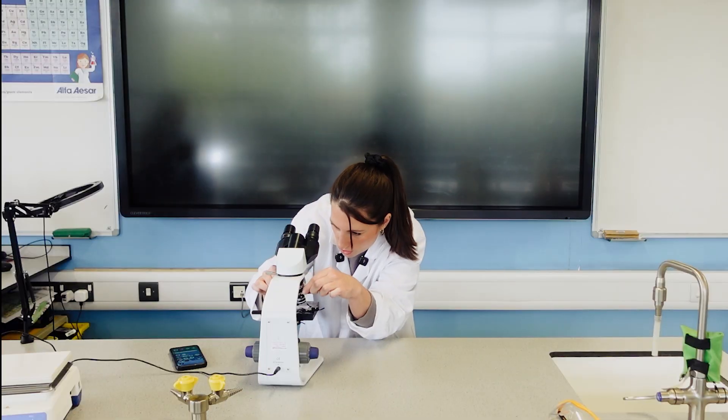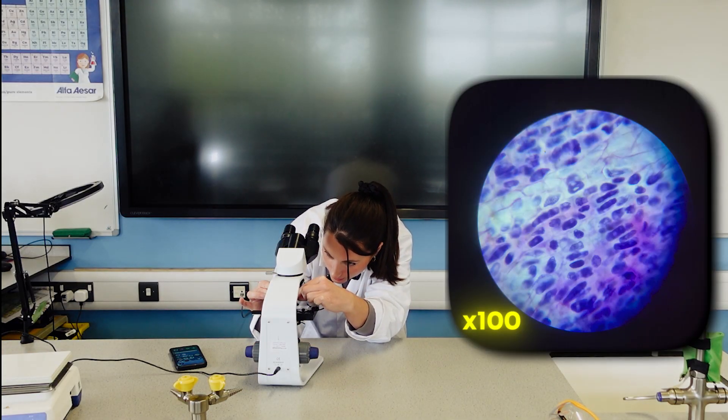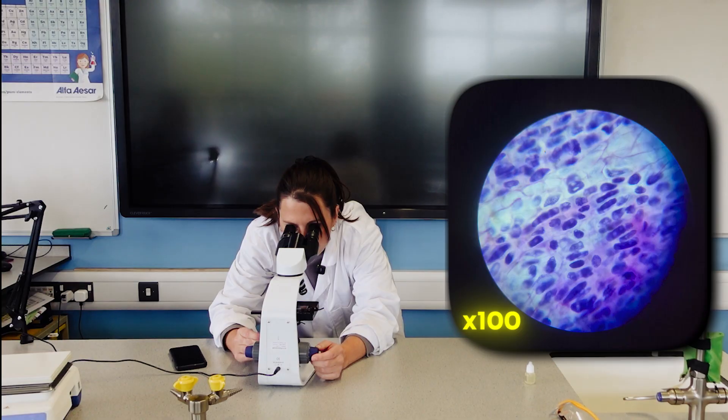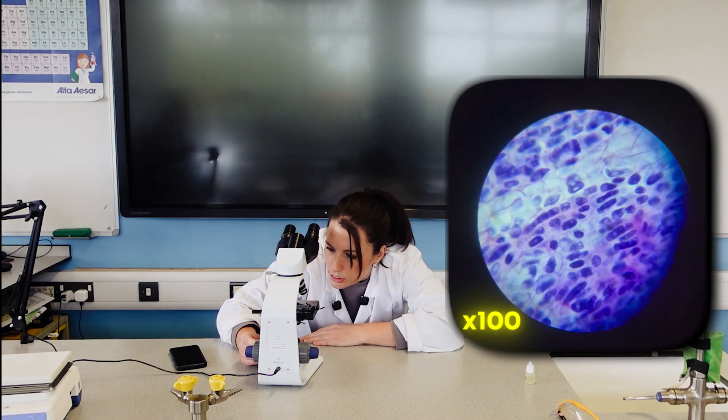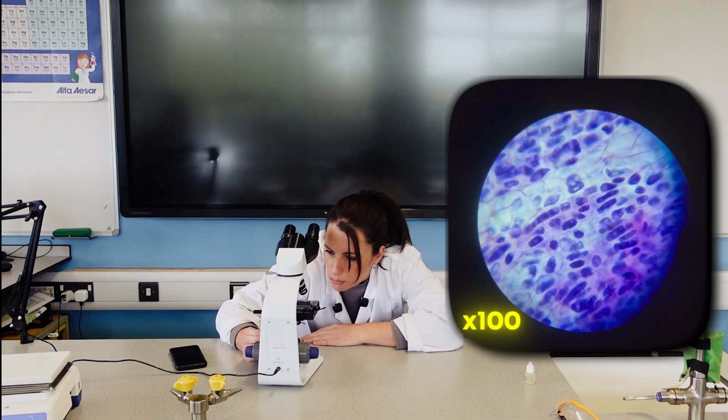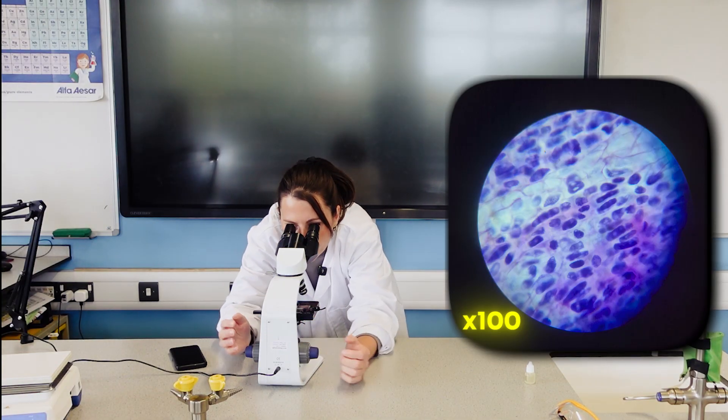I've actually got one here that goes up to 100 times. So let's just move that in place. I've actually lost the position of it now. Let's get you back. Oh, it's over there. Okay, so go this way, and then if I go backwards it should be bang under now. Yeah, there we go.